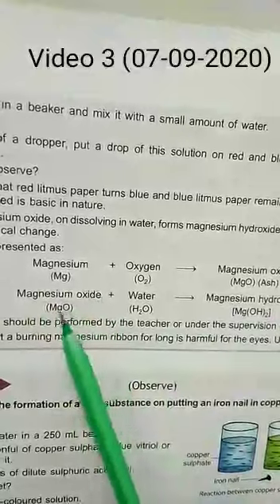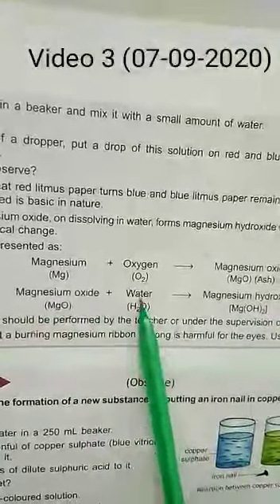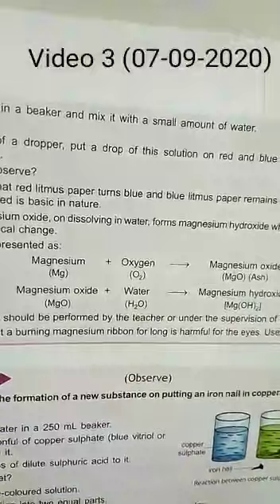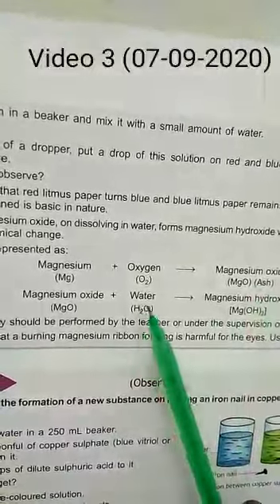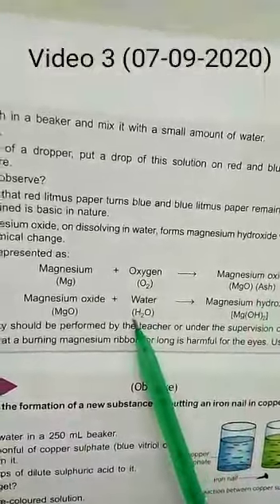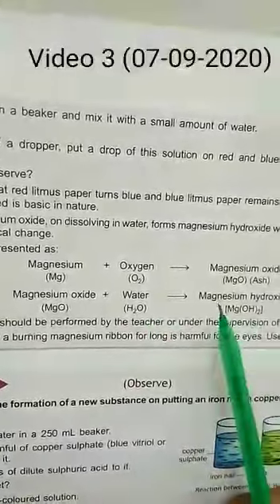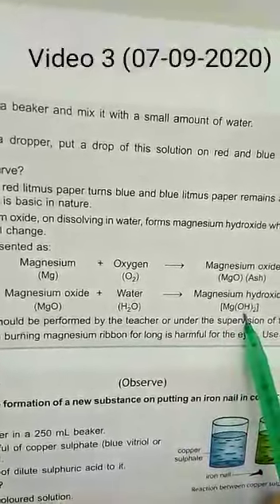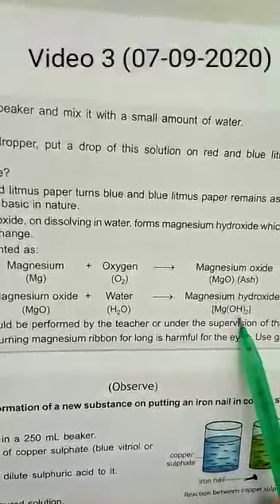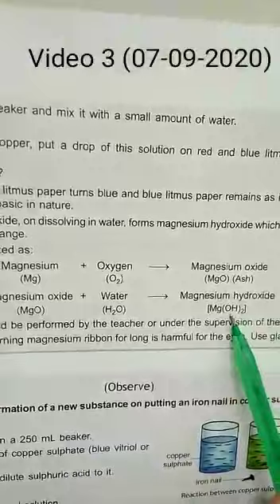Now this magnesium oxide will react with water. Whatever ash is there, we collect it in a beaker and add some water. This converts it into Mg(OH)₂, which is called magnesium hydroxide.